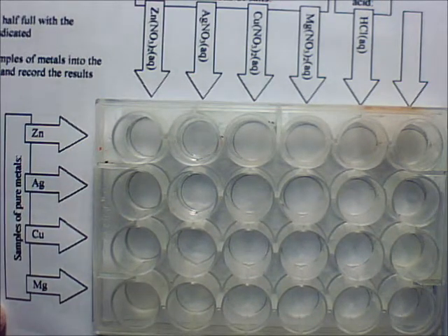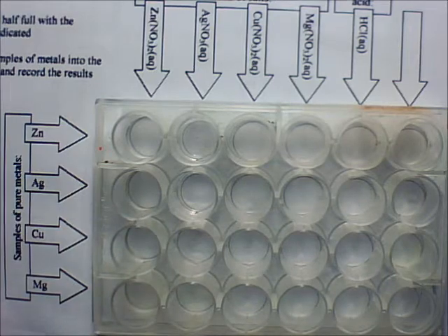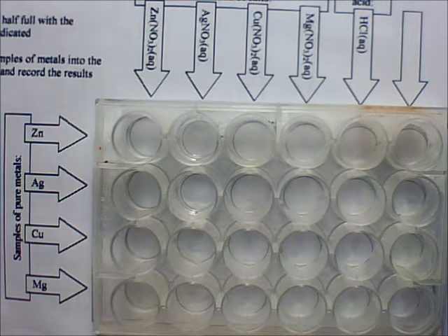The only thing I want you to be careful about is one of the things we are working with is hydrochloric acid over here. It's not really concentrated, but it could cause some problems, so be careful with that. When you are done, I put up a moment ago some instructions about how to handle the cleanup. I want to keep any unreacted metals. Metals that don't react in here, you're going to use some forceps, which are basically tweezers, like I used for the sodium a moment ago, and pull out those unreacted metals, rinse them off, dry them on a paper towel, and put them back in the baggie they came from. Does that make sense? Like for the cube, not for the shaving. Whatever's not reactive, just put them back in there. Okay?